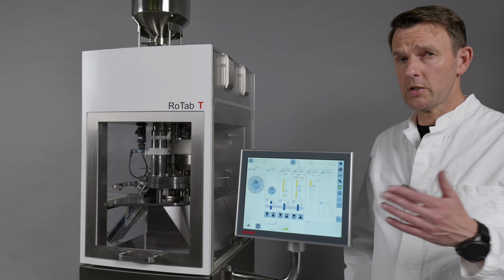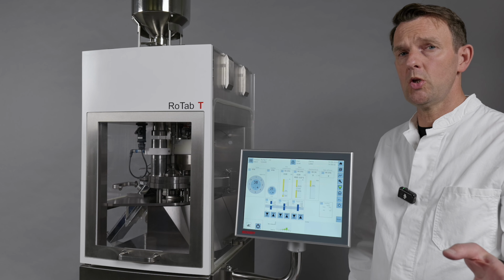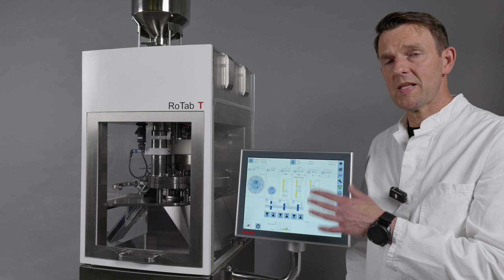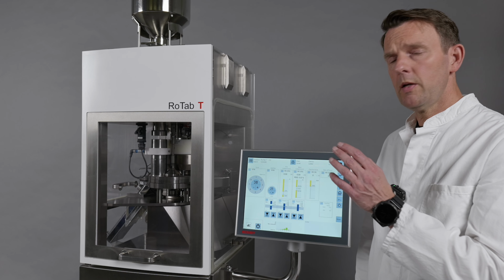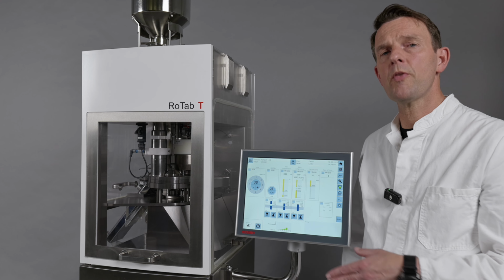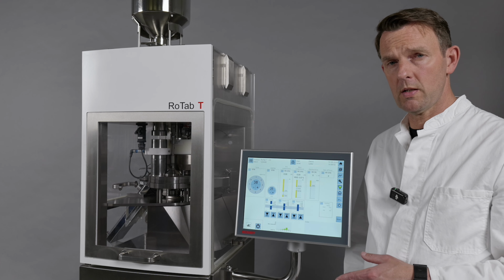My name is Ingo Krause and today I bring you some new photo and video material about our bestseller by far, the RoTab T 3.0. In the third version we have more than 100 units out worldwide.